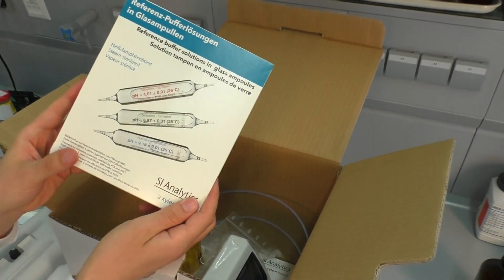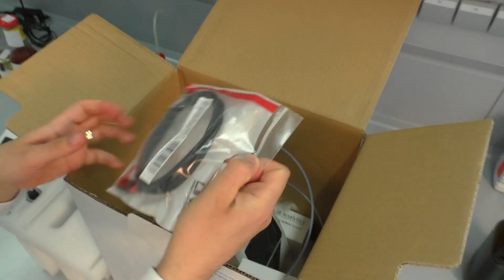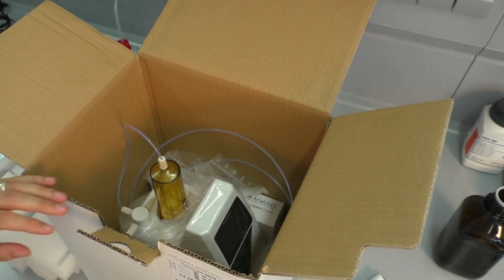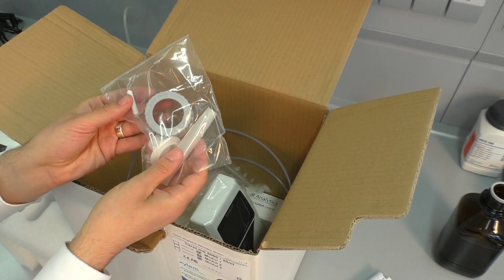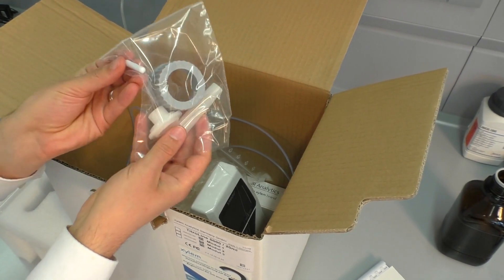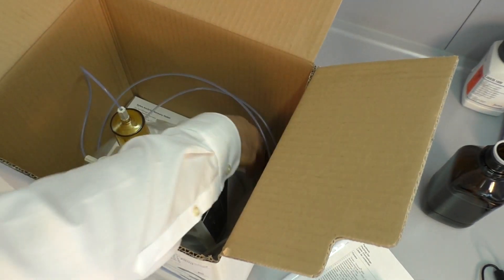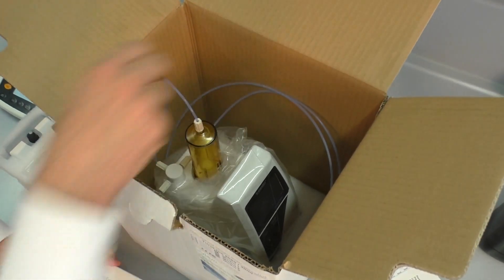Additionally, we have some buffer solutions for the pH calibration. We have a USB cable to connect the titrator to a PC, a power supply, an adapter to connect reagent bottles to the titrator and a magnetic stirrer. A storage vessel for the pH electrode, a pH electrode, and of course the titrator itself.